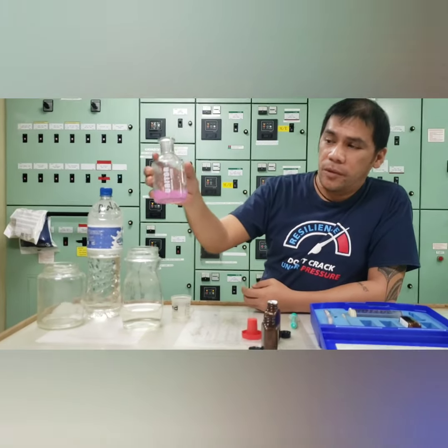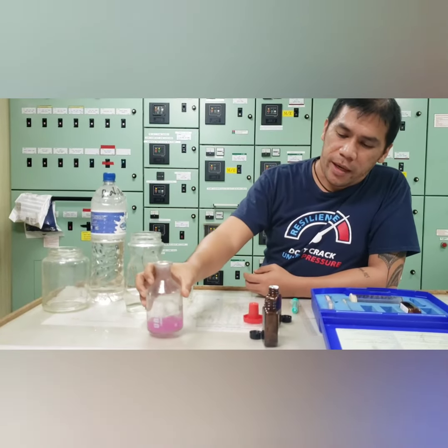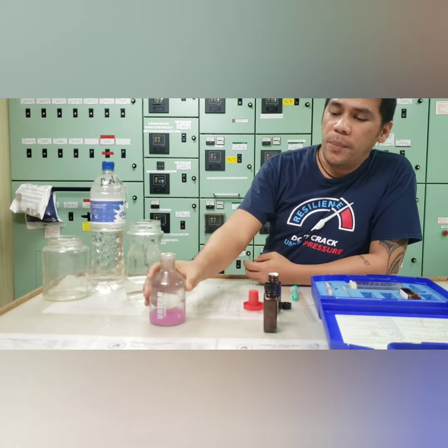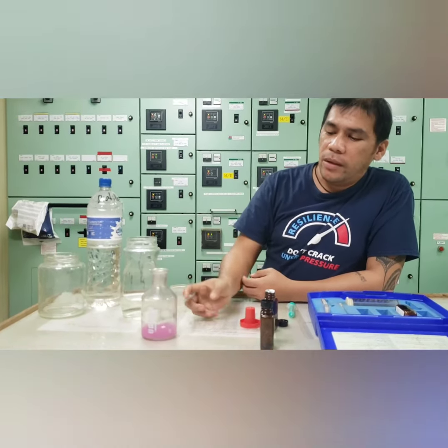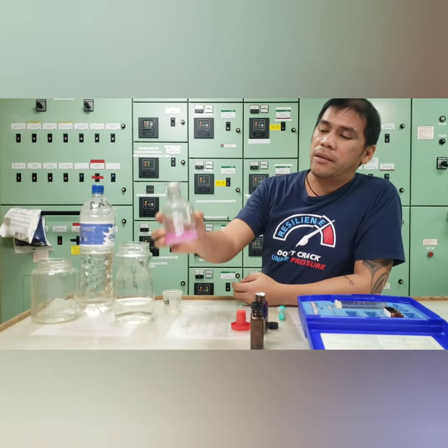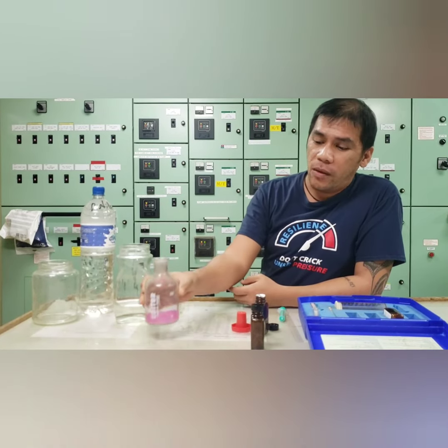So now we can compute how much is the nitrite content of our cooling water. To compute with this, we're going to multiply the number of tablets into 180. So the minimum of this nitrite test is 1,000 to 2,500 is the normal rating value.